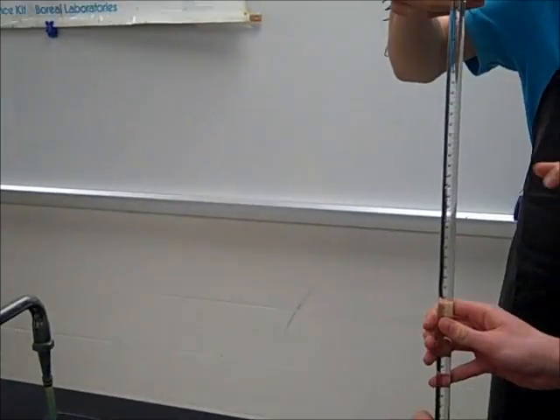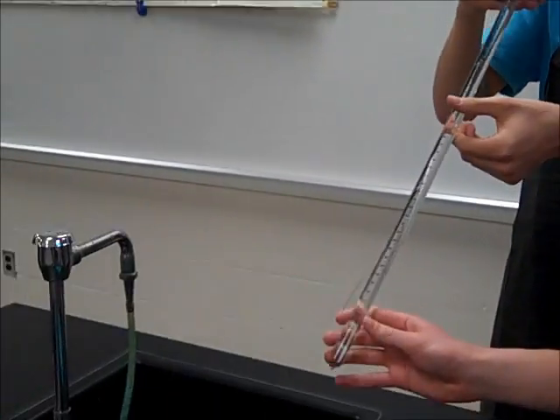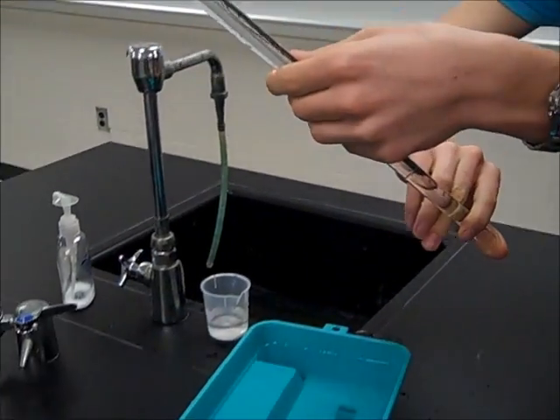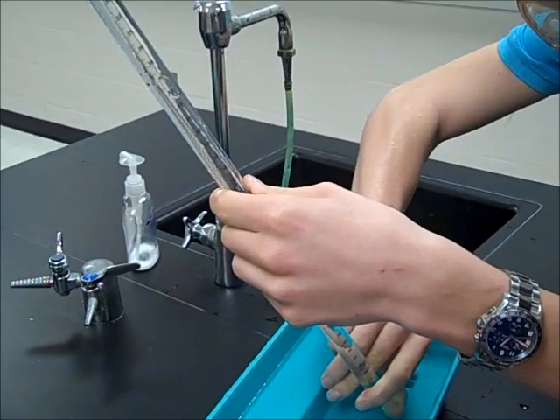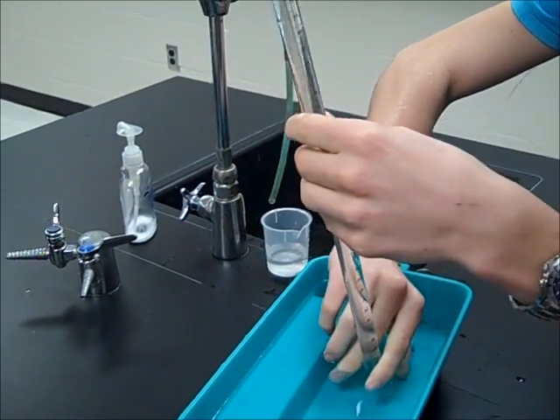Okay, and then you're going to invert it and place it into your tray. And don't let your thumb go until it's under the surface there.